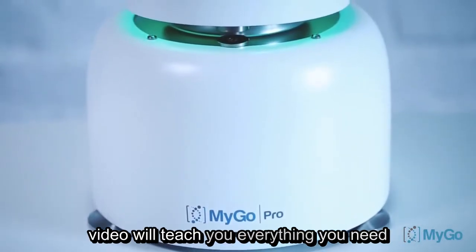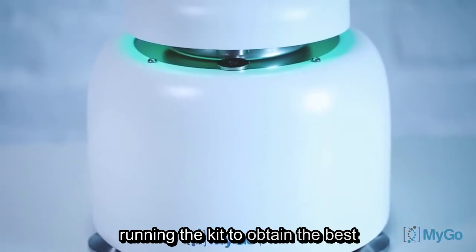This video will teach you everything you need to know when storing, handling and running the kit.